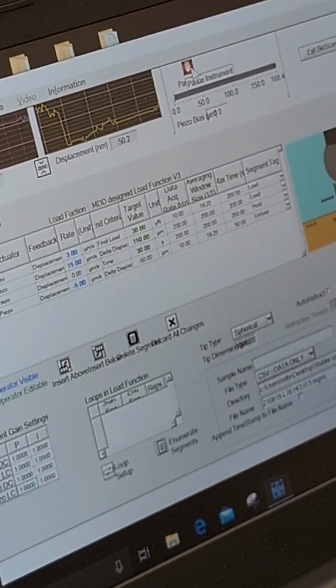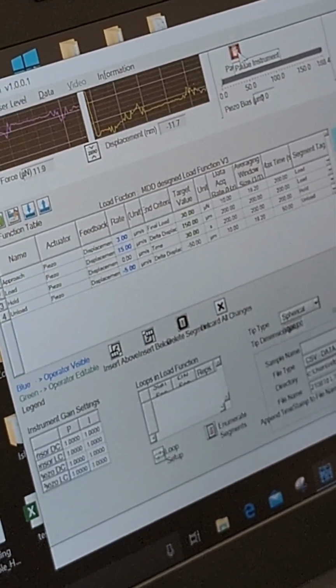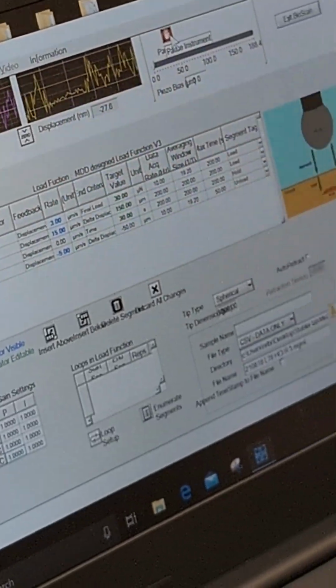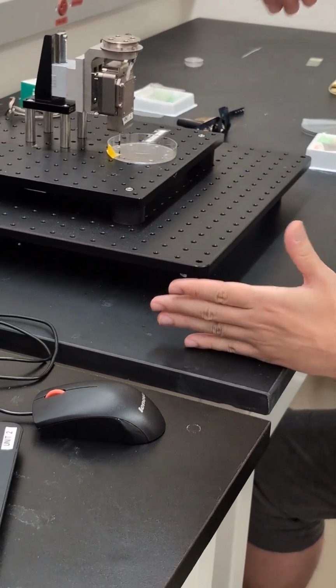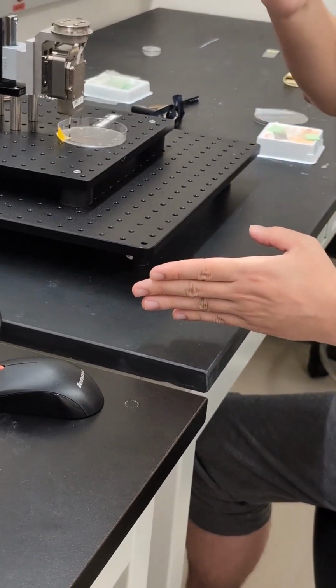For my format, I generally start with a negative 100, so that I know I'm giving it enough space to have this movement. It's like having a hammer striking a nail. You don't press the hammer onto it. You give it a little bit of distance, and then the force hits it.